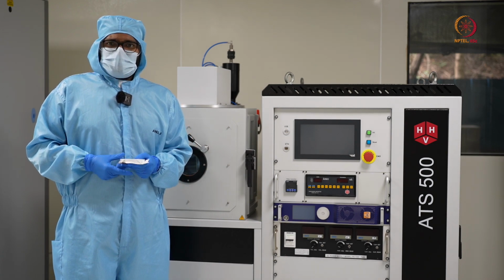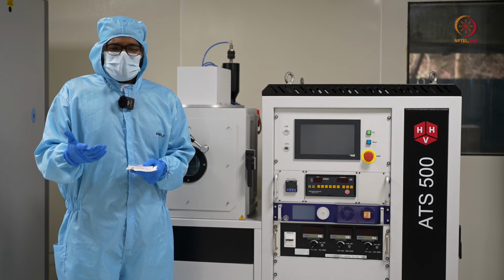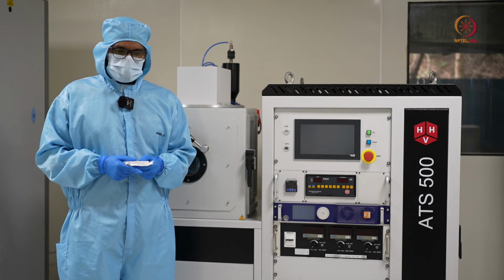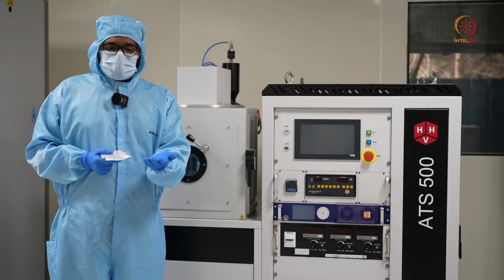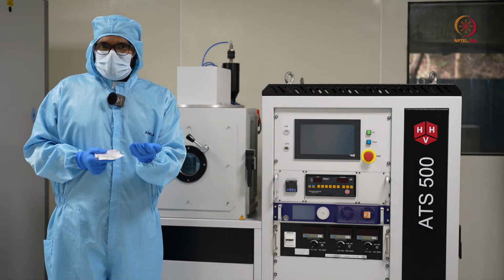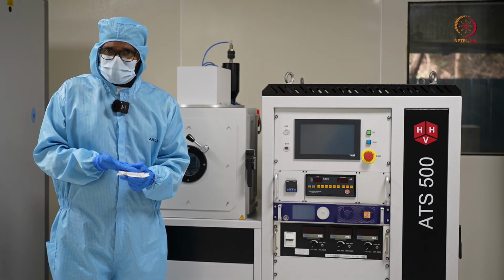Now that we know how to create an argon plasma, what is the use of it? Since I mentioned earlier that the bottom plate will be negatively charged, that is where our source will be.